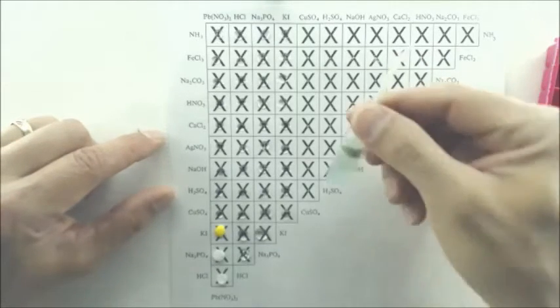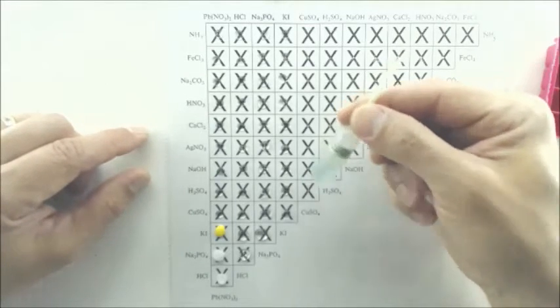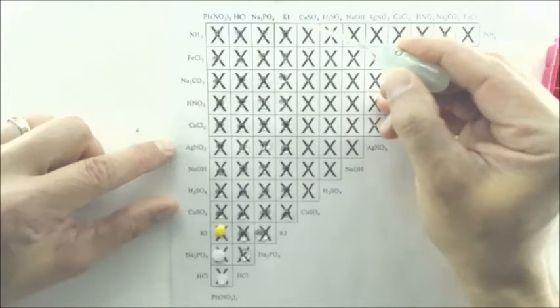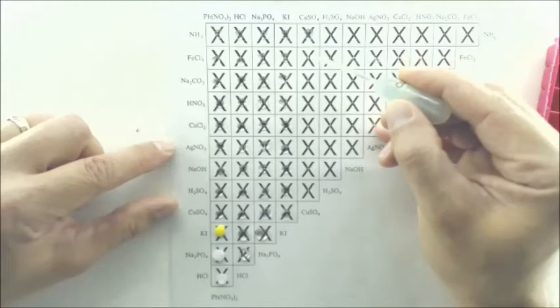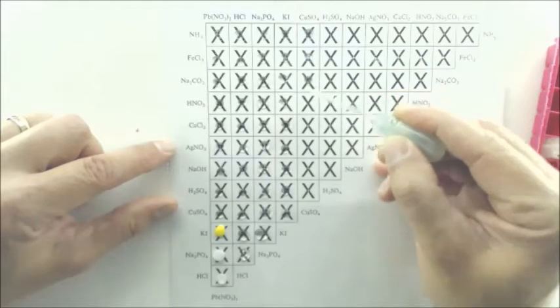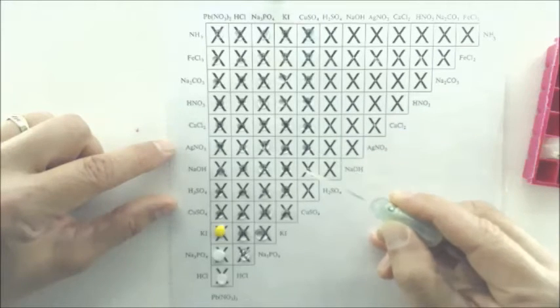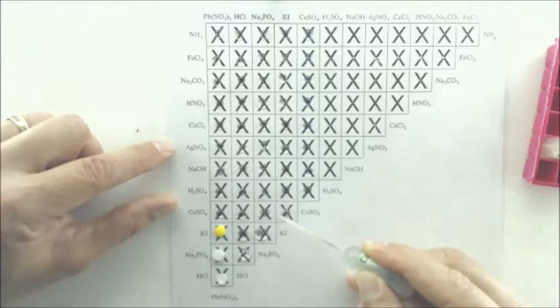Here's the copper sulfate next. I want to draw your attention to the fact that the solution itself is blue, and that is a very helpful clue when you're doing the unknowns. Whoops, that's like 4 drops. So on the grid here, it probably won't show up on camera very well, but it'll appear pale blue. If it stays pale blue, that's kind of a no reaction. Now around the corner.